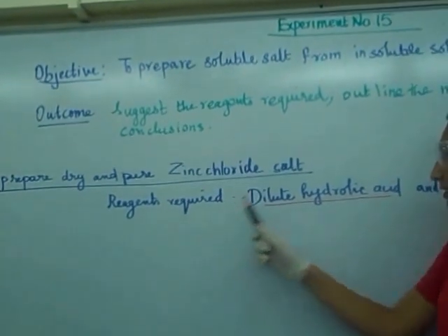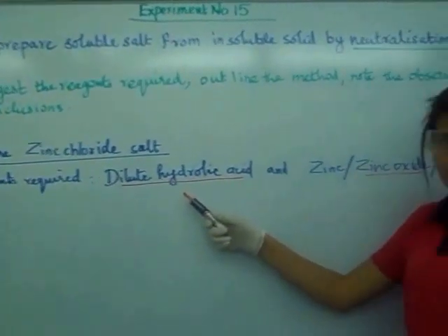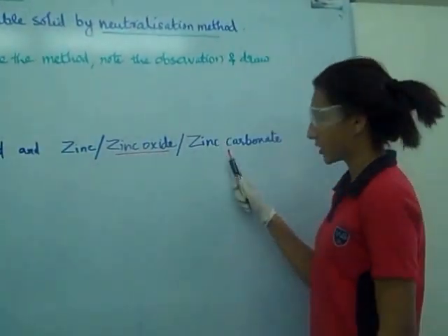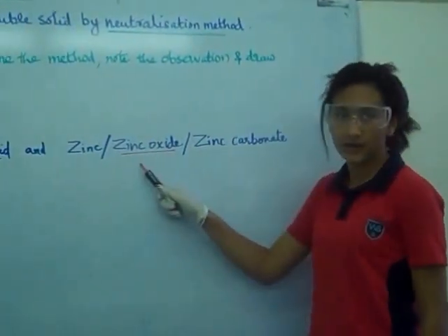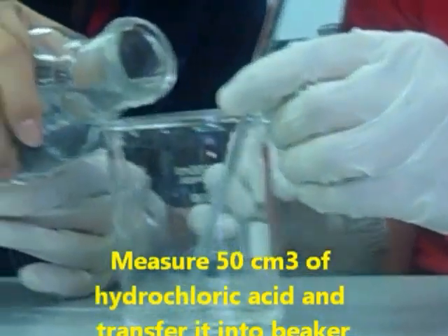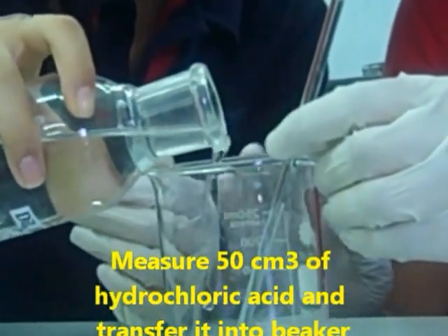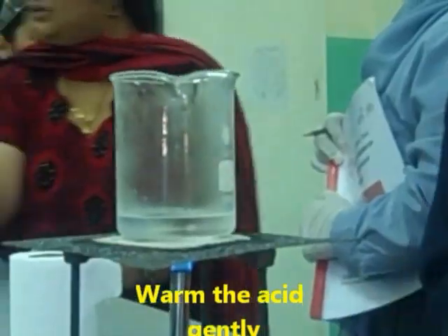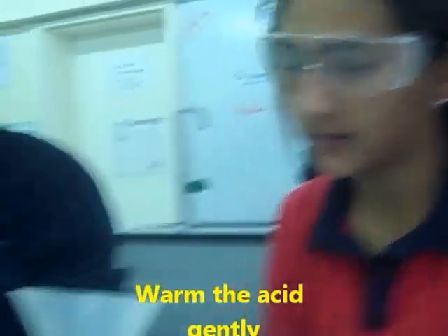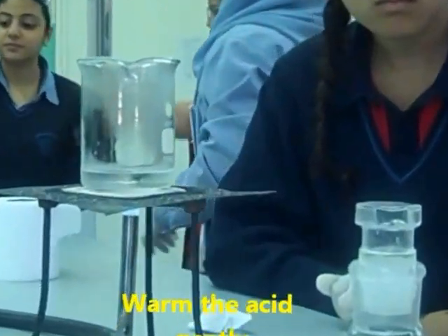The reagents required are dilute acid, zinc or zinc oxide or zinc carbonate, but now we are using zinc oxide. Now we are warming the acid so we can add the zinc oxide powder.